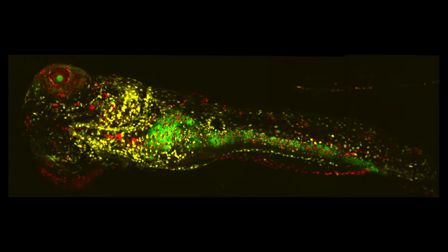So for example, if we look at this image here, we've got the liver, which is marked in green. Or we can zoom in even further down to a single cell, which is highlighted there in yellow and red. So the yellow and red are two different processes that are occurring within that fish. And when that fish was imaged, it would have been imaged live. So we're looking at what's happening within the live fish in real time.